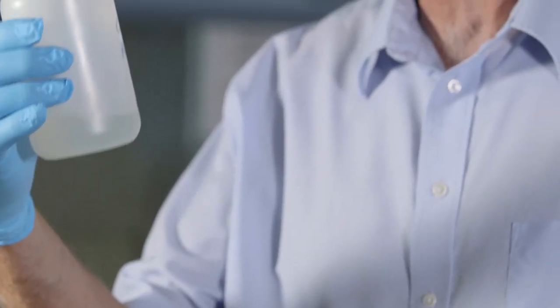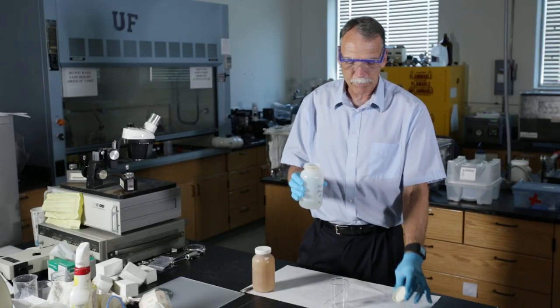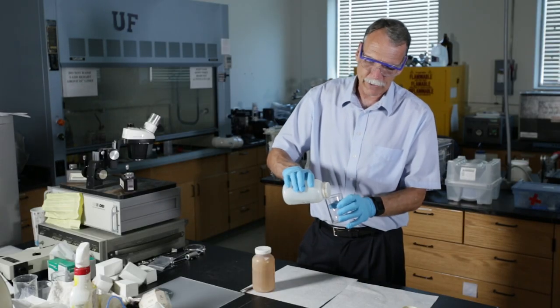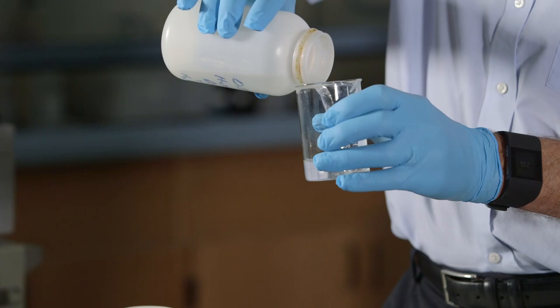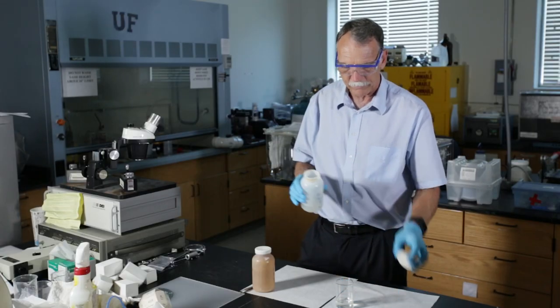So what I'm going to do is I'm taking a little of the hexamethylenediamine and I've dissolved it in water. So now I'm going to pour that into a beaker. When I do that, there it is, just looks like a clear liquid solution in water.